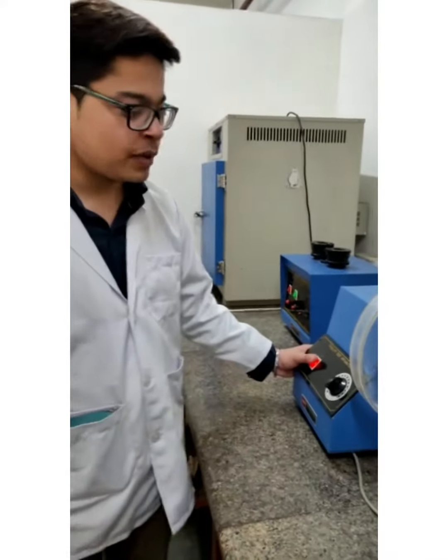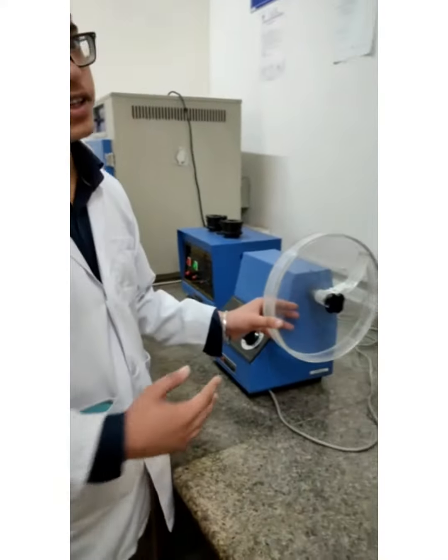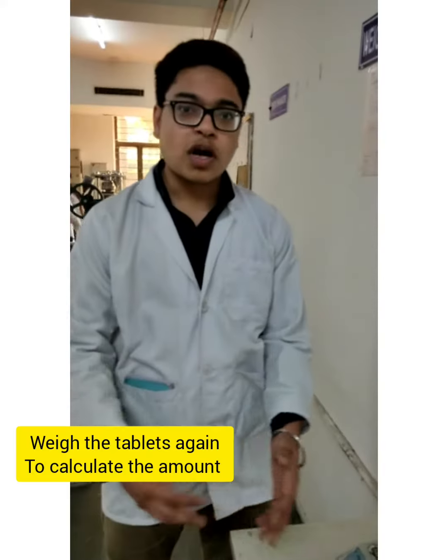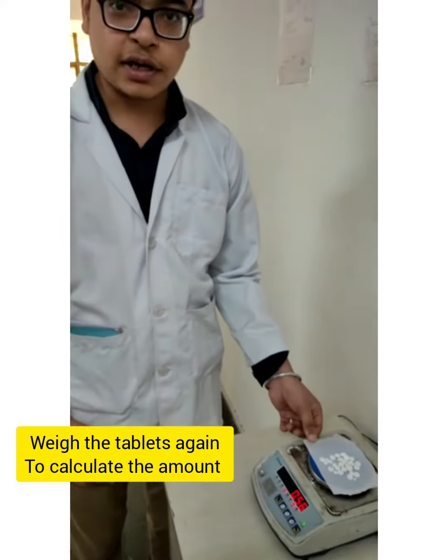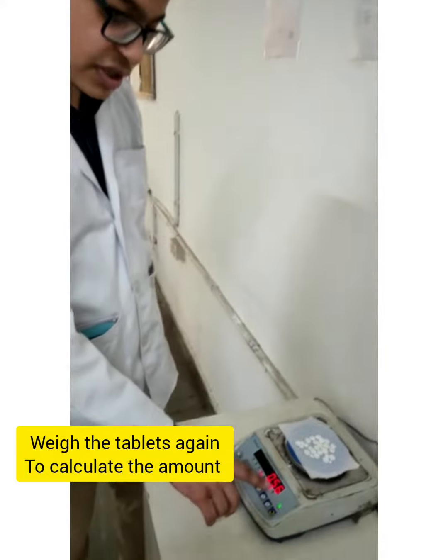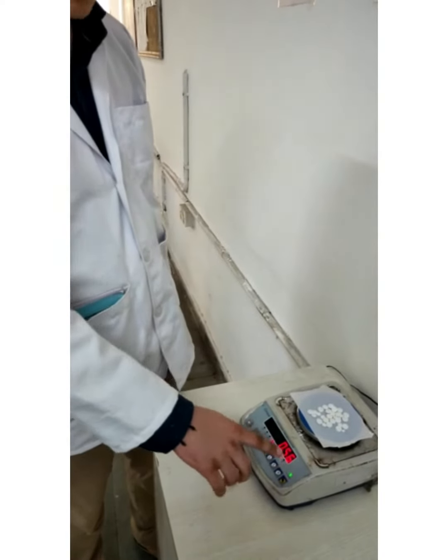Now we have run it for 4 minutes. We turn off the apparatus, remove the tablets, and weigh them again. After the friability test, we are again going to check the weight. As you can see, the weight has decreased from 0.6 to 0.56, and then we can calculate the difference.